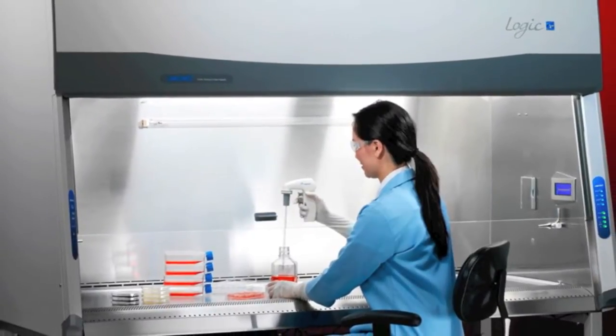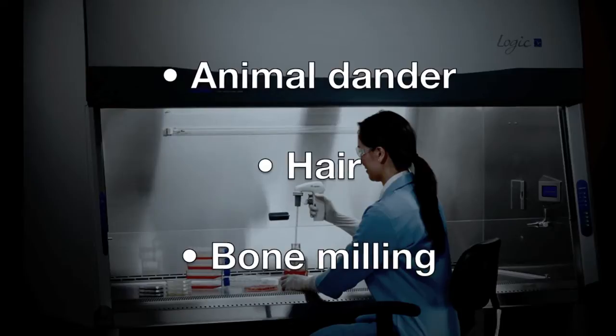For applications that are troubled with large particulates, such as animal dander and hair, or bone milling, a pre-filter can be instrumental in increasing the life of a biosafety cabinet's HEPA filters.